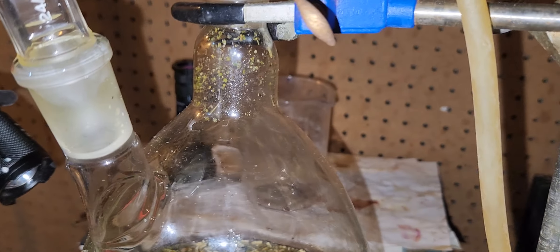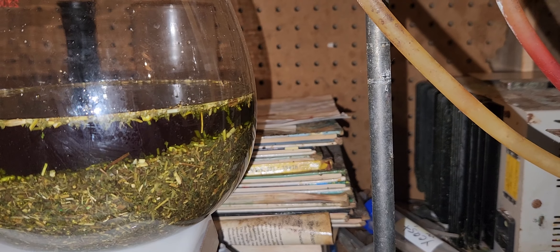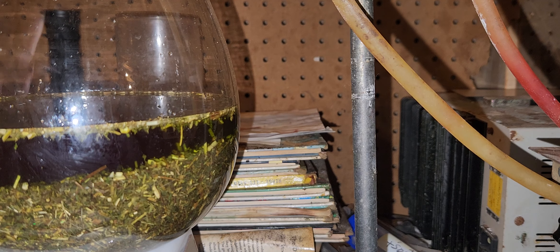If you look very carefully, I don't know how, but a little bit of resin is boiling with it. A little bit of resin from this material got onto the flask.